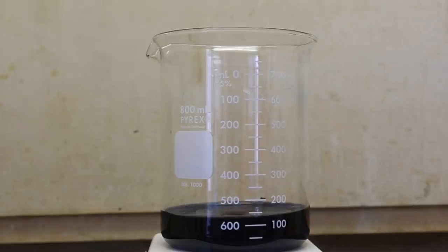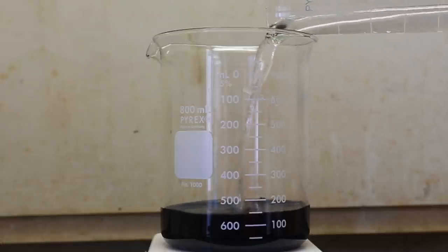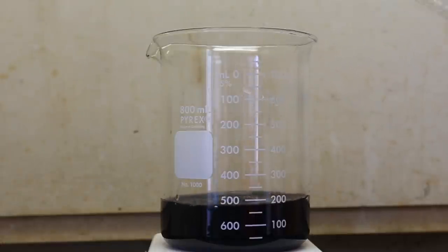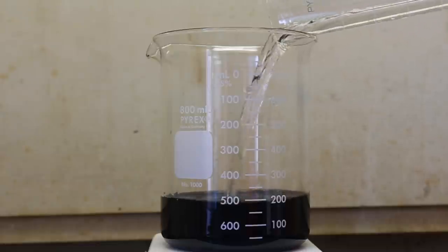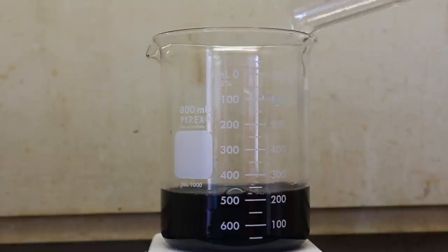After all the copper hydroxide had dissolved, I added another 50 milliliters of ammonium hydroxide. After this final addition of ammonium hydroxide, the Schweizer's reagent is ready.